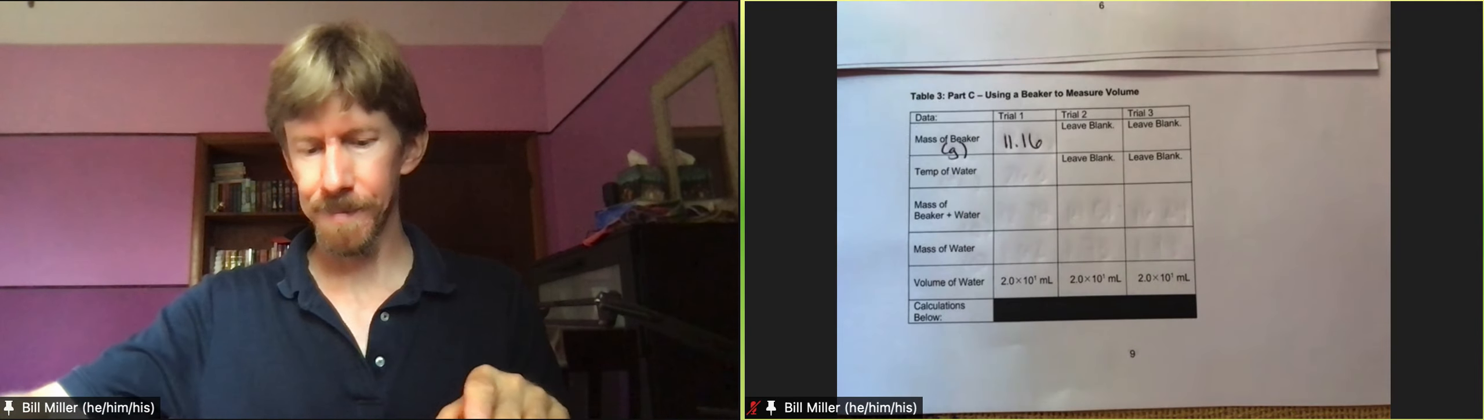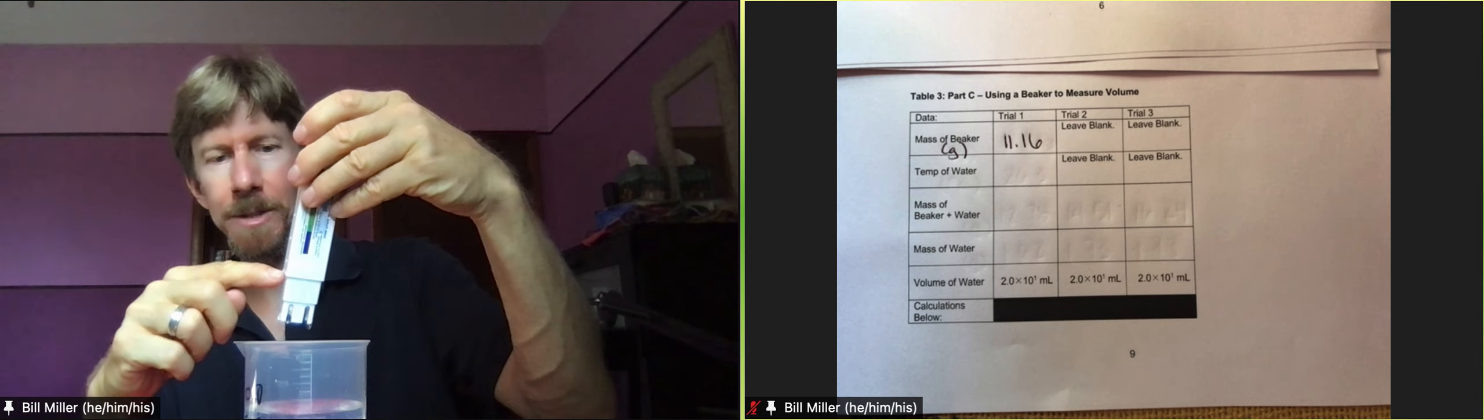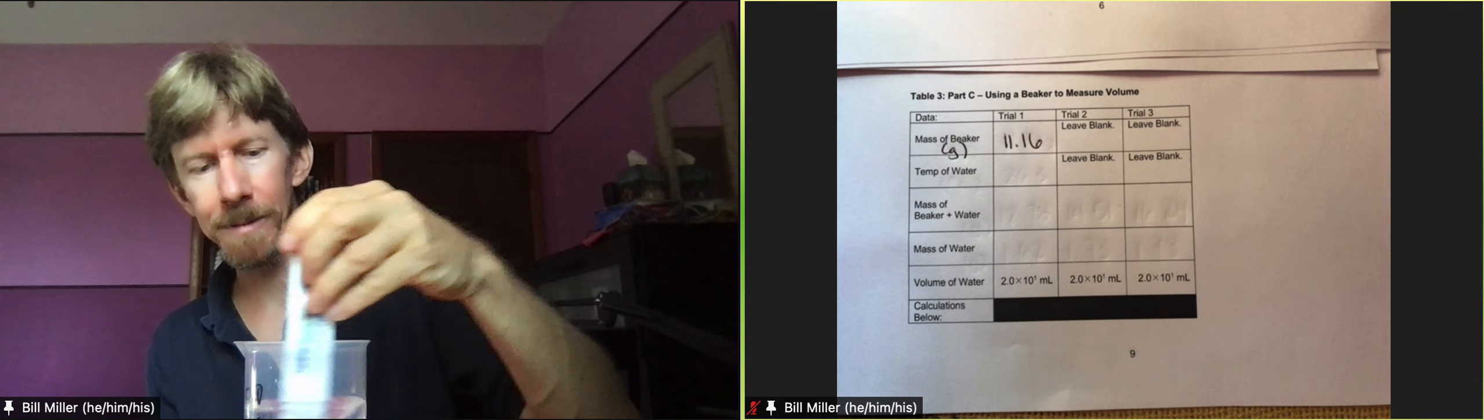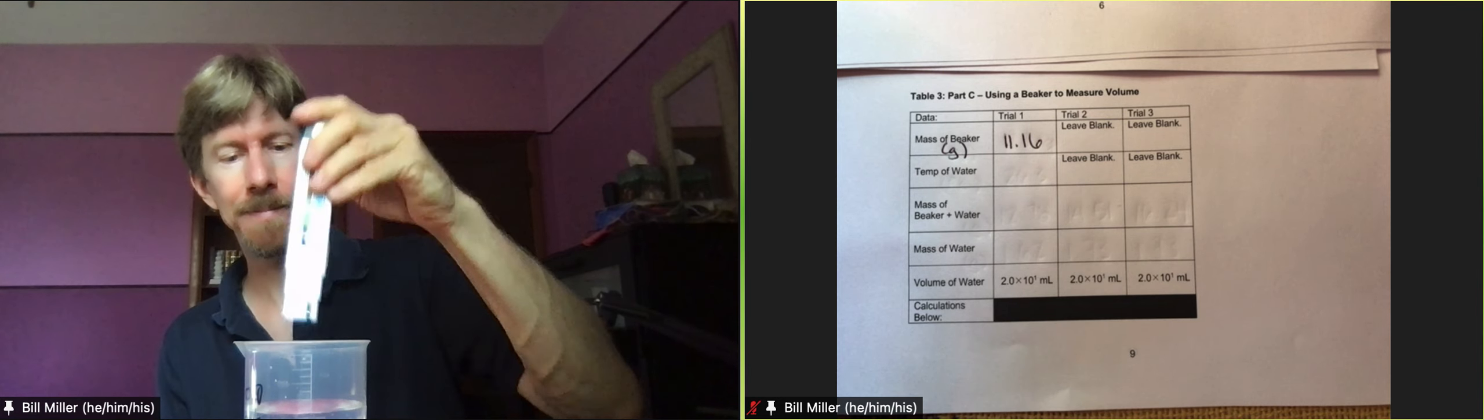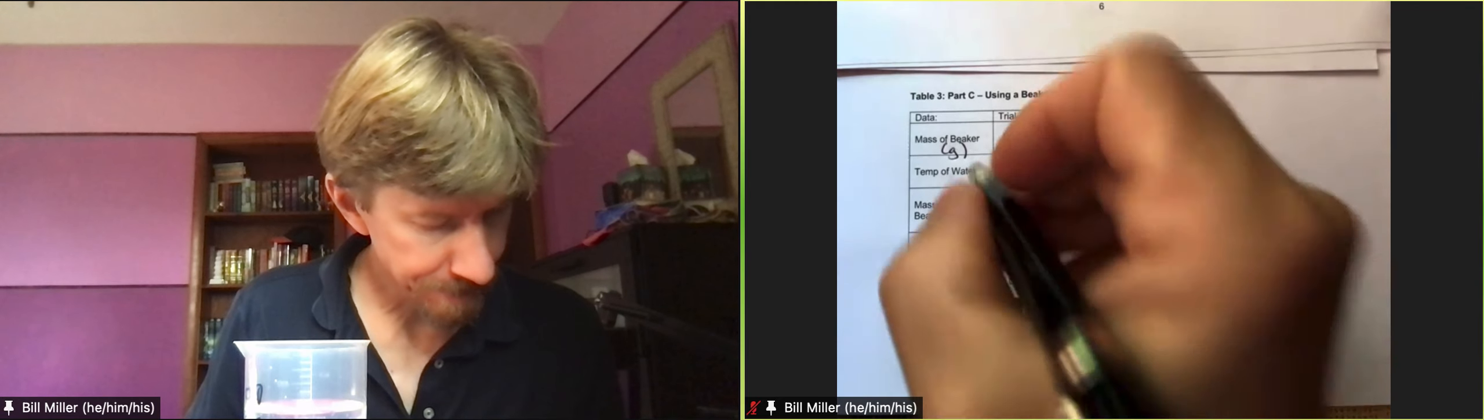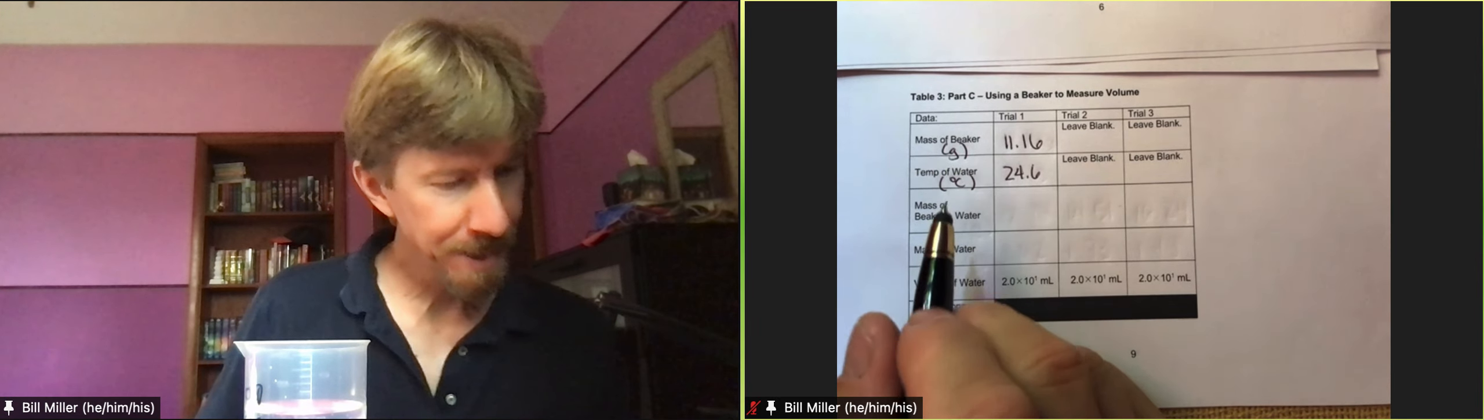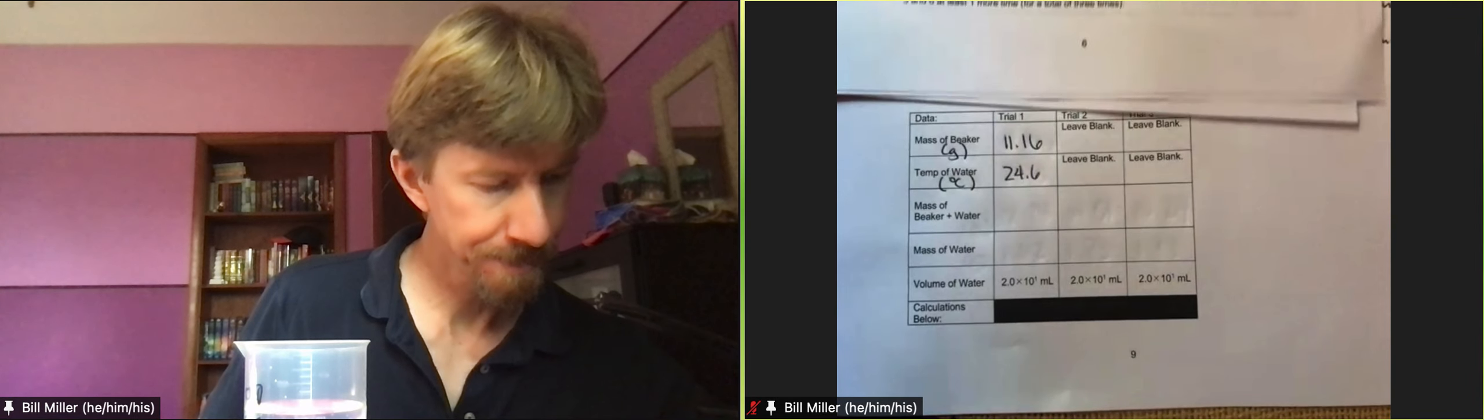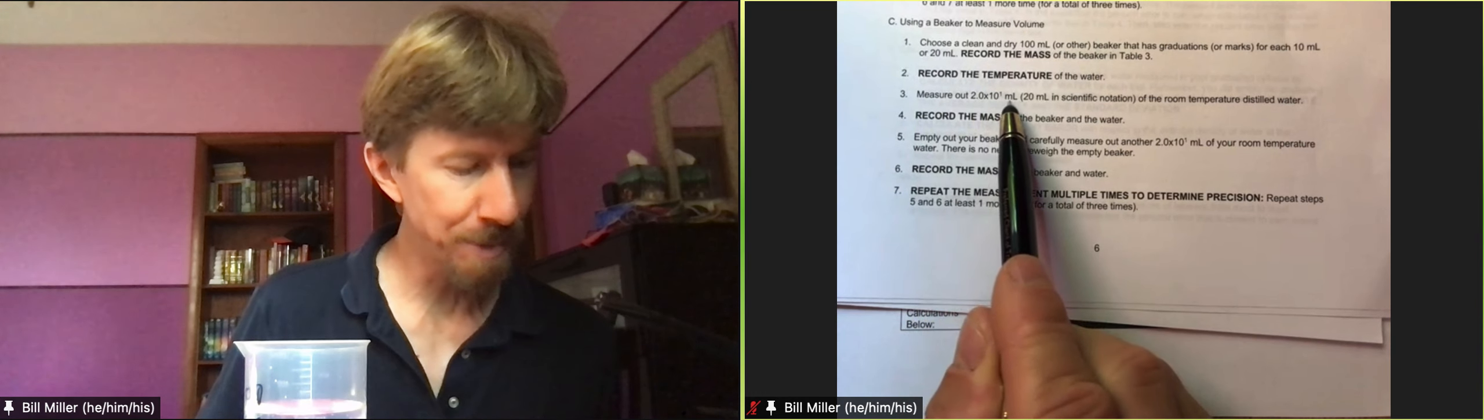Time to take the temperature of my water again. Again, I'm only putting it up to right there in the water. Swirling. I get 24.6 this time. And turn it off.